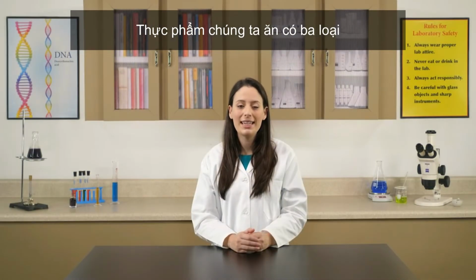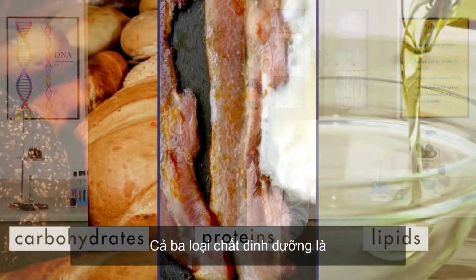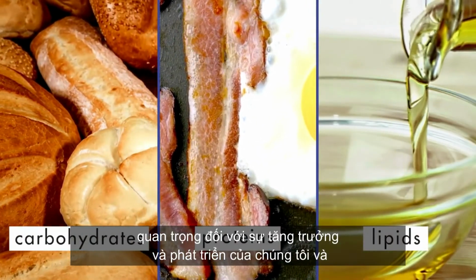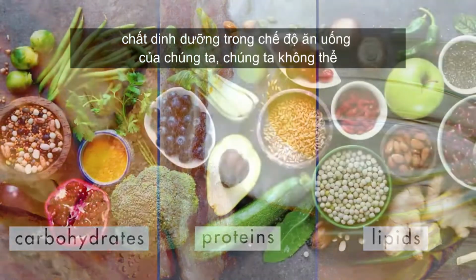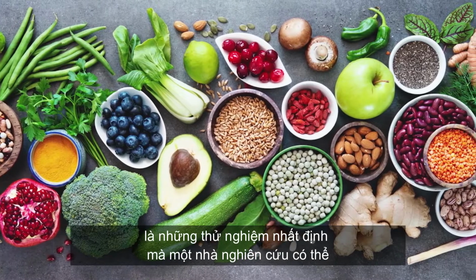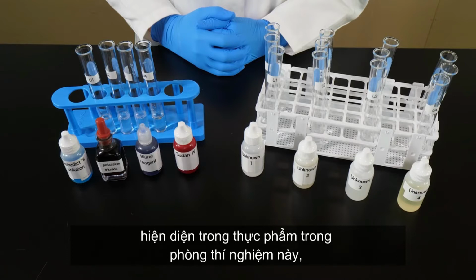The food we eat contains 3 types of nutrients: carbohydrates, proteins, and lipids. All 3 types of nutrients are vital to our growth and development, and it is important that we have a balance of nutrients in our diet. We cannot always look at a food source and tell what nutrients it contains. However, there are certain tests a researcher can perform to determine what nutrients are present in food.